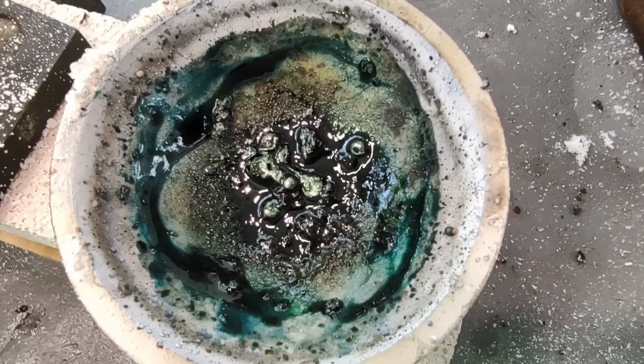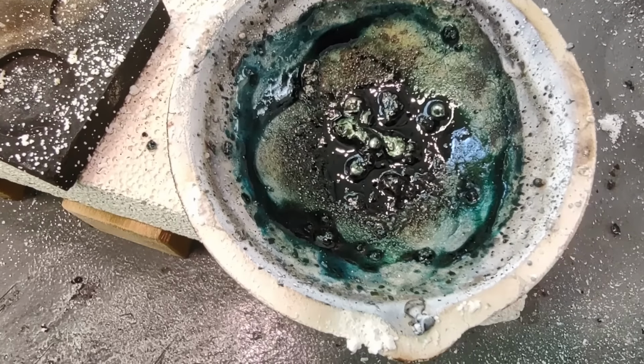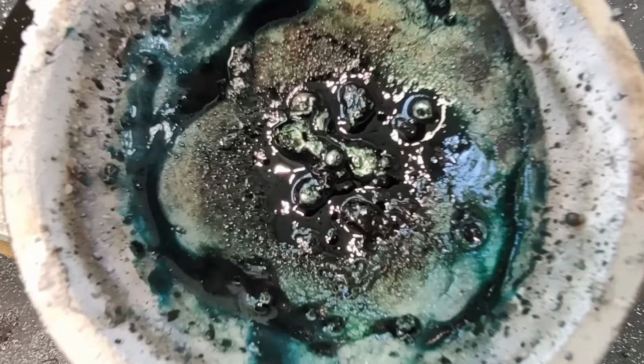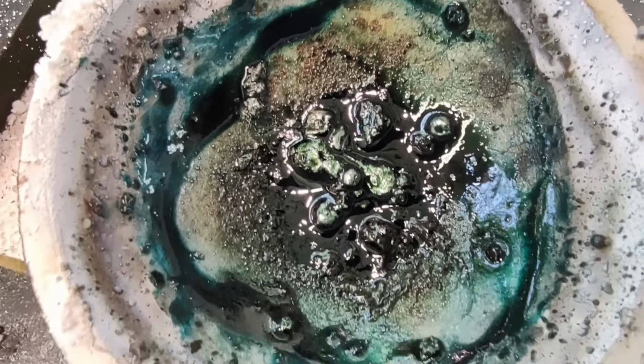So here's the inside of the crucible. Wow. That borax has turned an interesting color in there, but you can see the metal beads. I just can't get them hot enough to consolidate into one big bead.